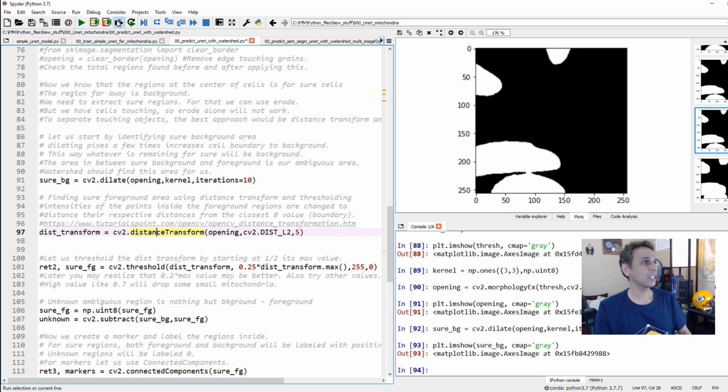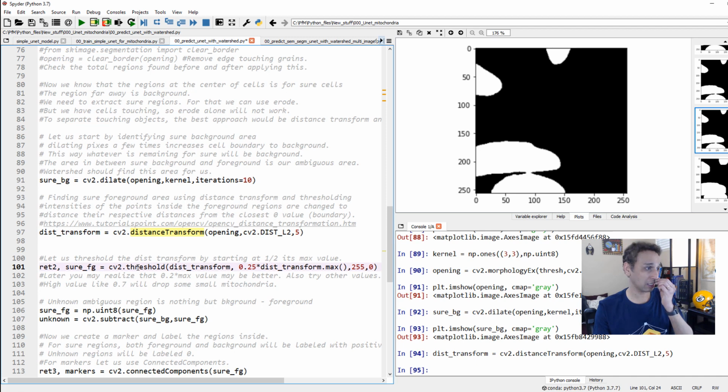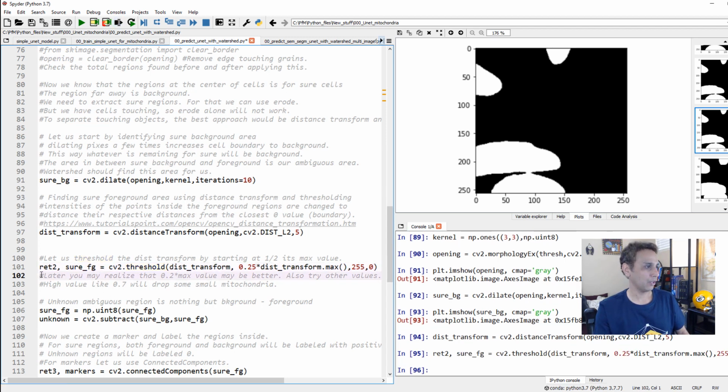Okay, so let's do distance transform here, and based on the distance transform image, I'm going to threshold some of the pixels. Okay, so now I have a distance transformed map. For each of these, like for this image, I'm segmenting that map. I'm thresholding that map basically, so I get the sure foreground. So let's go ahead and do this so you understand exactly what we are trying to see.